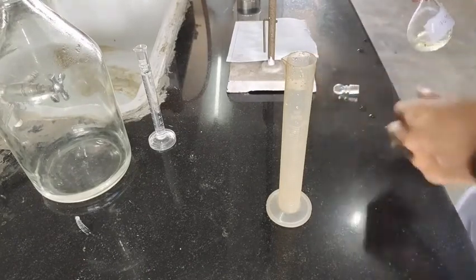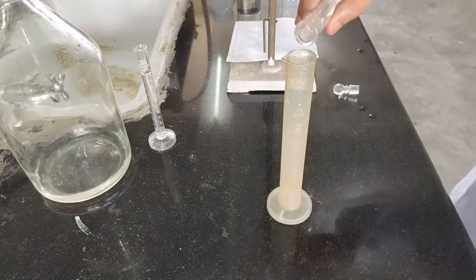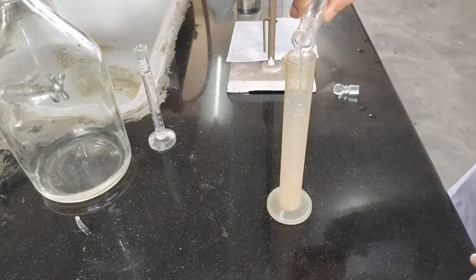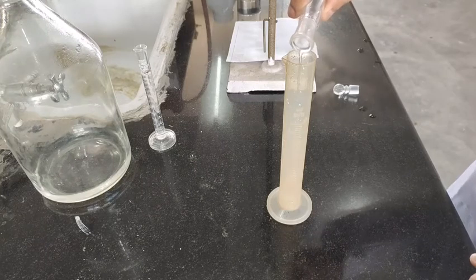Now take a 20 ml measuring cylinder and measure 1 molar sulfuric acid in it. Take 20 ml of the sulfuric acid.